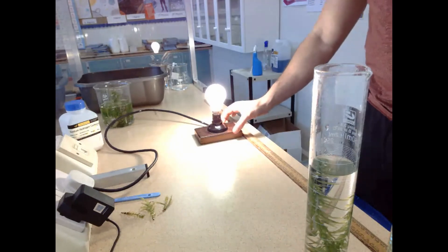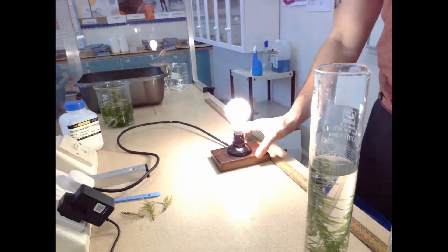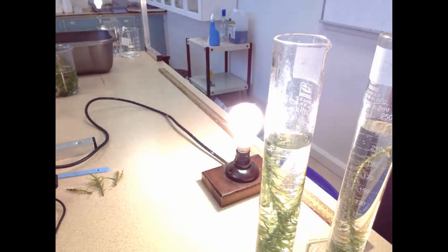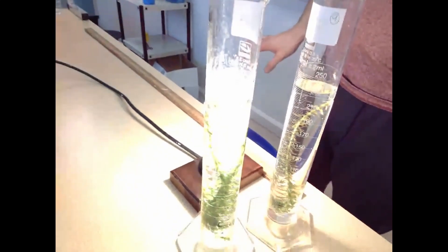It should also be noted that as I brought the light bulb in by 10 centimeters each time, I gave the plant about five minutes to react to its new level of light intensity and then counted the level of bubbles being produced. I don't need to show you every single time, but what I will show you is what happened when the light bulb got to 10 centimeters away.